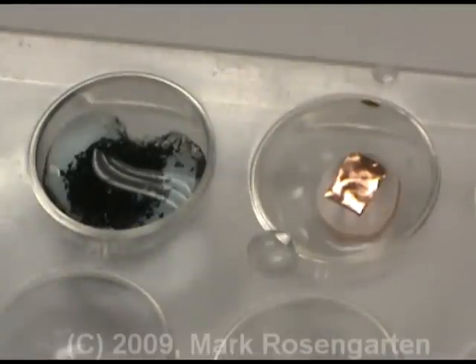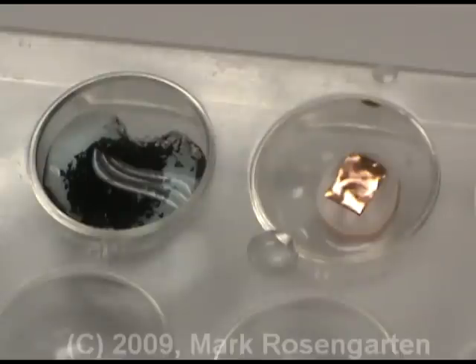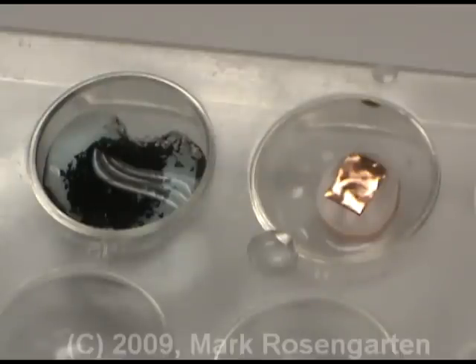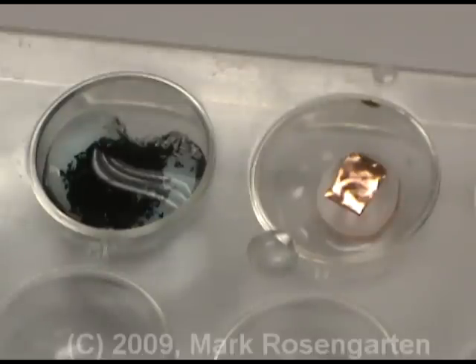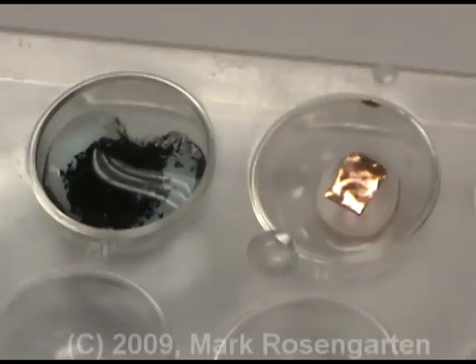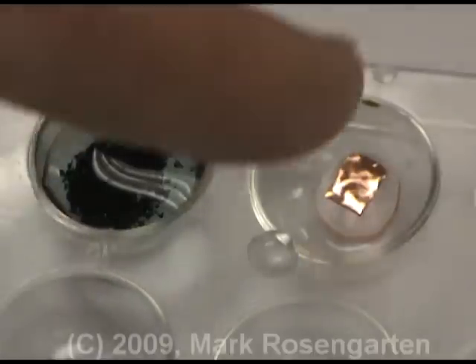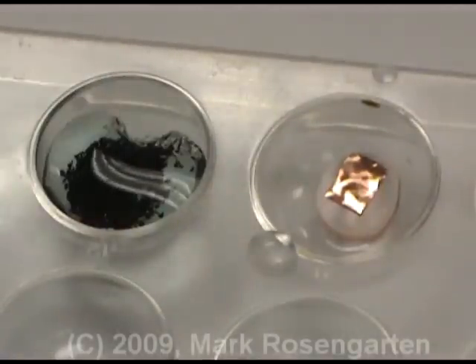The zinc has turned from being metallic to being black. That black you see is actually microscopic crystals of copper that reflect light in every different direction, which makes it appear black because the crystals are so small — whereas the copper has been completely untouched. The zinc replaced the copper, but the copper was unable to replace the zinc.